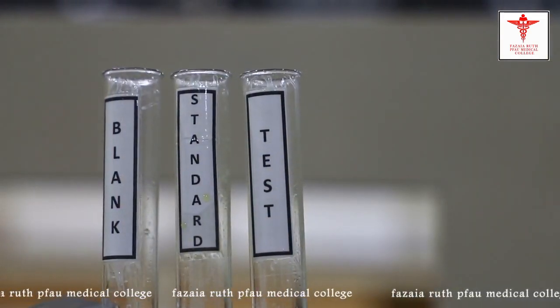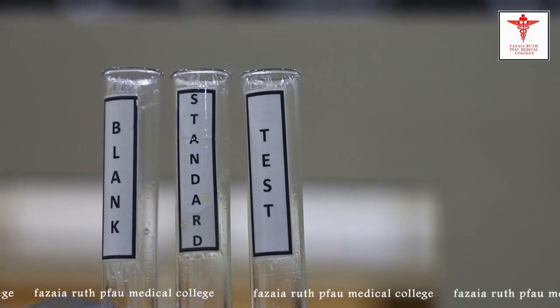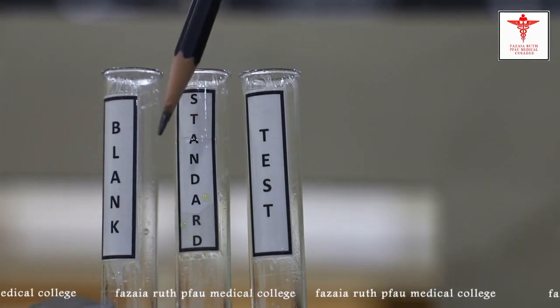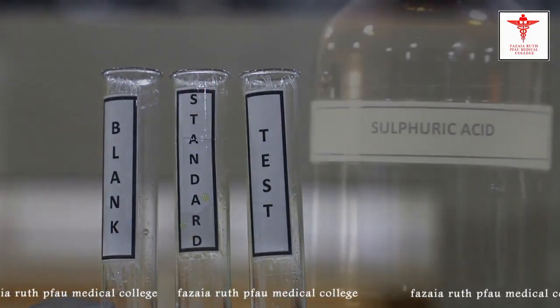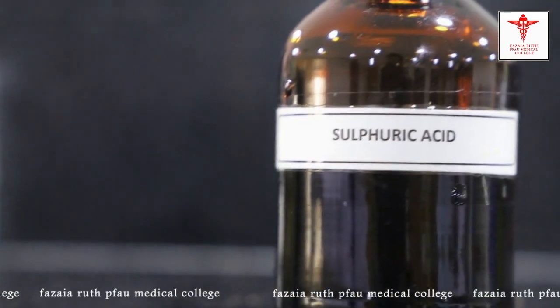We had added ferric chloride in all the three test tubes. Now we'll add sulfuric acid to all three test tubes.